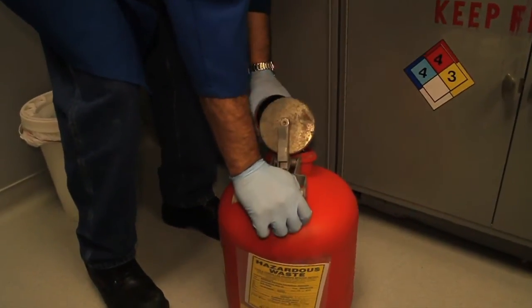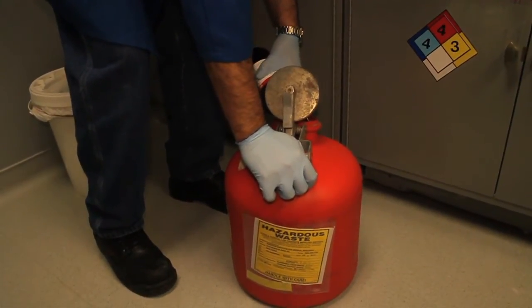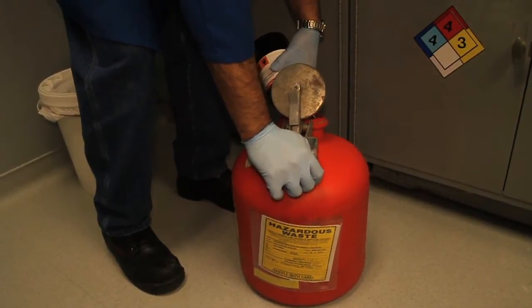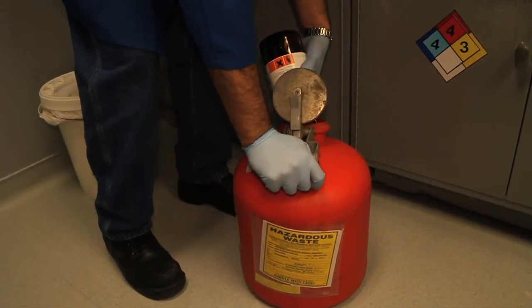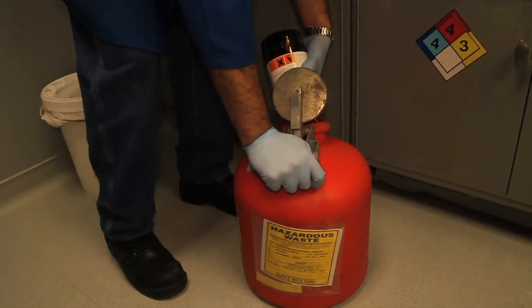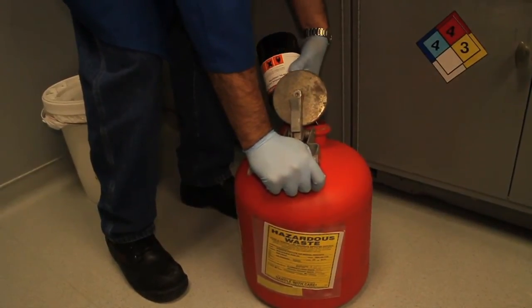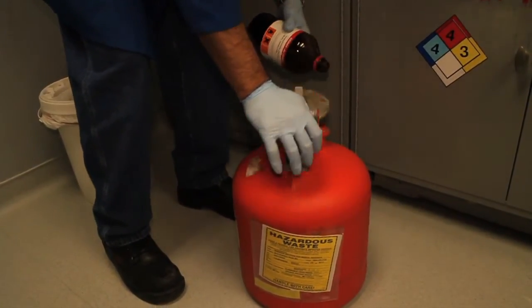Then dispose of this mix into the flammable organic solvent waste container. Repeat this step three times to ensure that there is no residue left in the glass bottle.